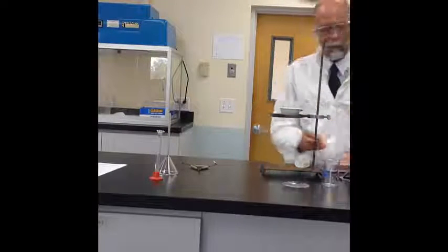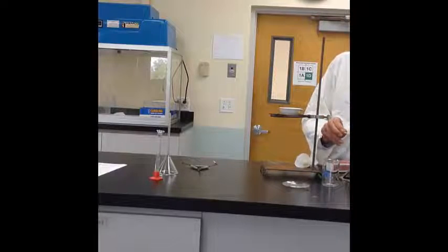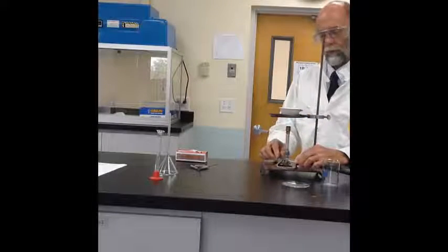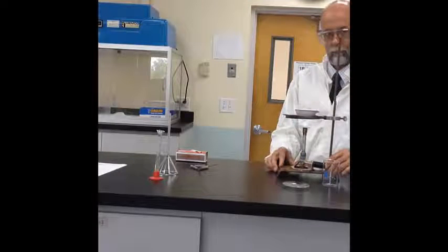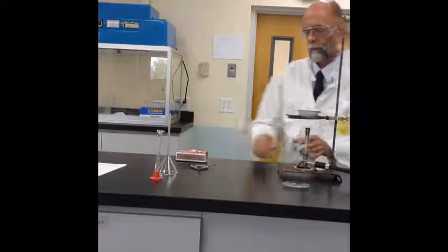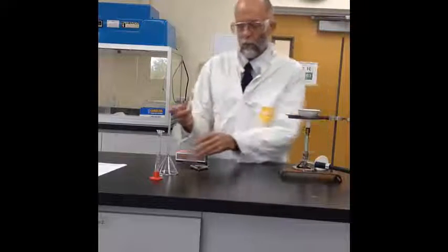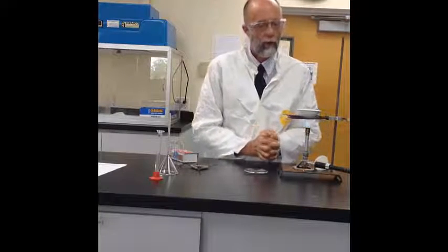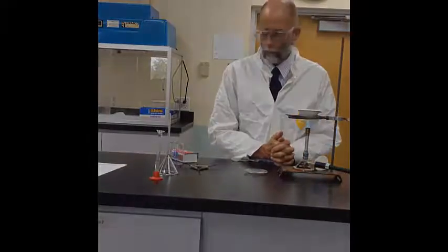we can proceed to light our Bunsen burner. Remember, strike the match before turning on the gas to the Bunsen burner. And once we have the Bunsen burner lit, we will continue to heat the evaporating dish and begin to evaporate off the water. We should bring it to a gentle boil, so we don't need a terribly hot flame, but a gentle flame will work. And if it gets too warm, we may need to move the burner out from underneath the evaporating dish so that we can have a gentle boil taking place. We don't want it to splatter.